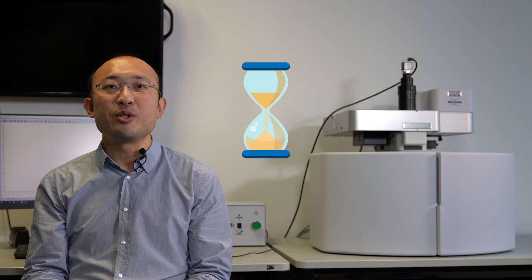This can take between some minutes to 20 minutes, and should be repeated after every grating or laser change. Doesn't sound like much effort, at first.